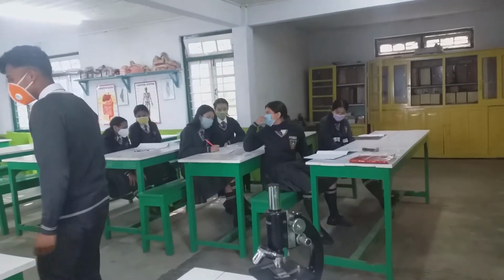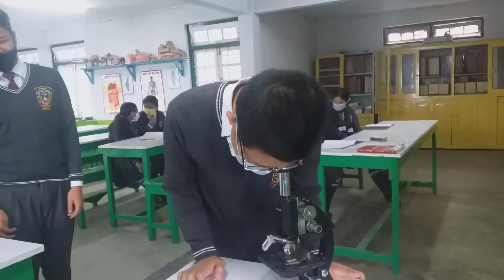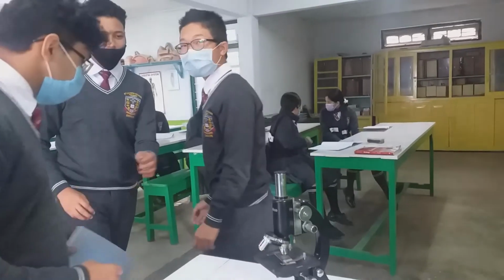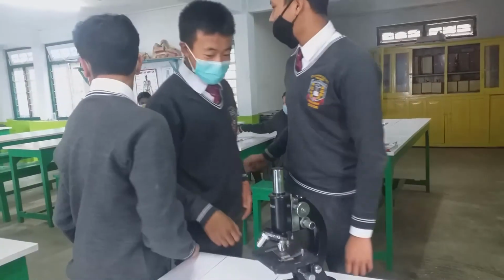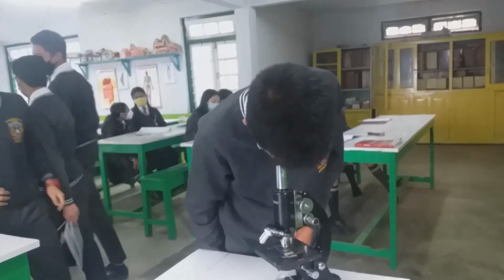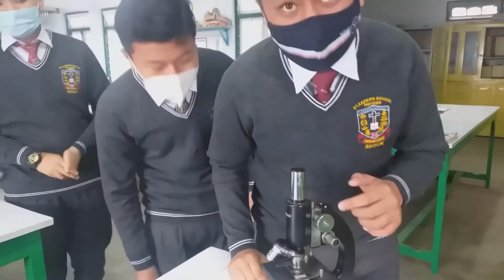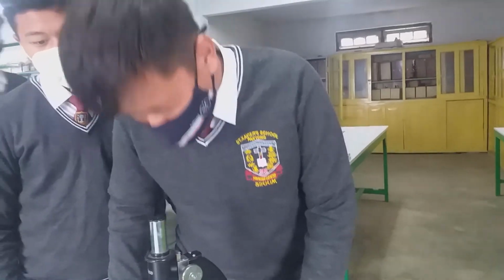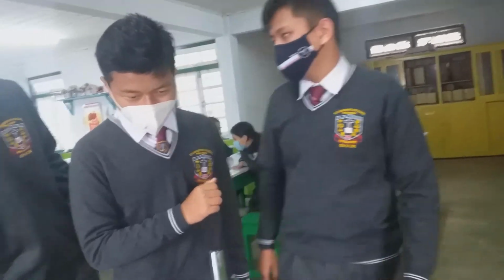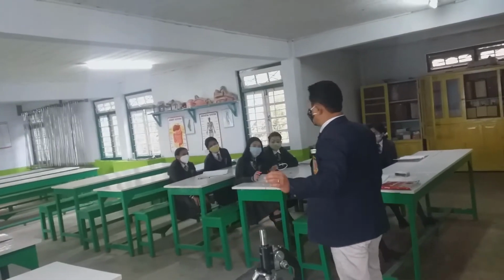Yes, next, fast. Can you see? This is the transverse section of intestine of mammal. What you see there is all actually the same. Yeah, it's better you draw. This is how we have to see.